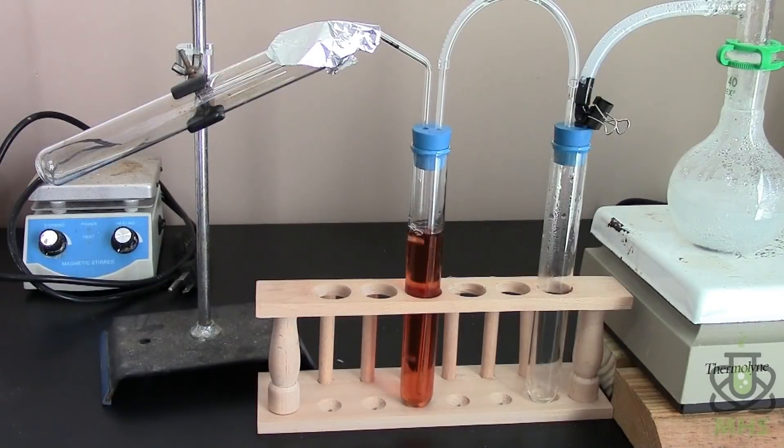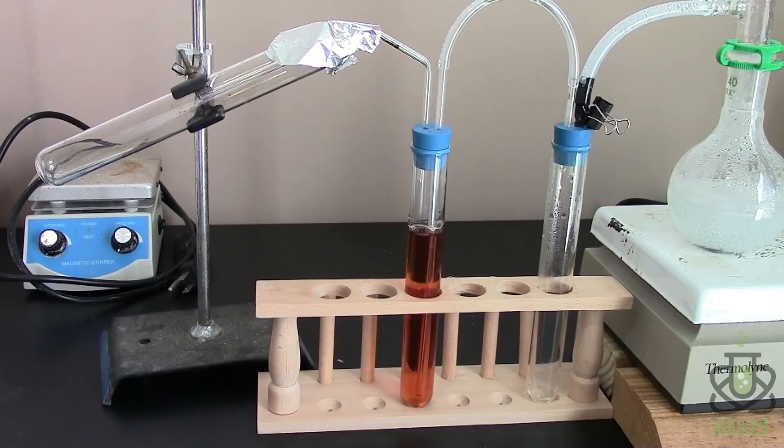So the bubbling is starting to slow down and that's probably due to the reactants starting to get exhausted but it's also probably due to more leaks springing up. So I guess I'm going to take it apart and see if we can't test this.